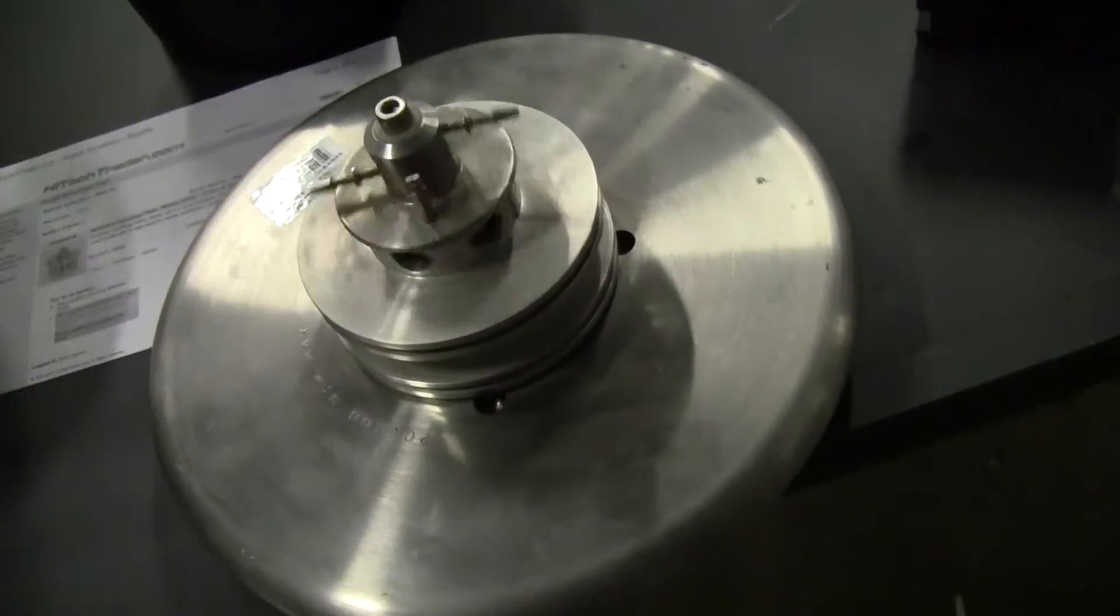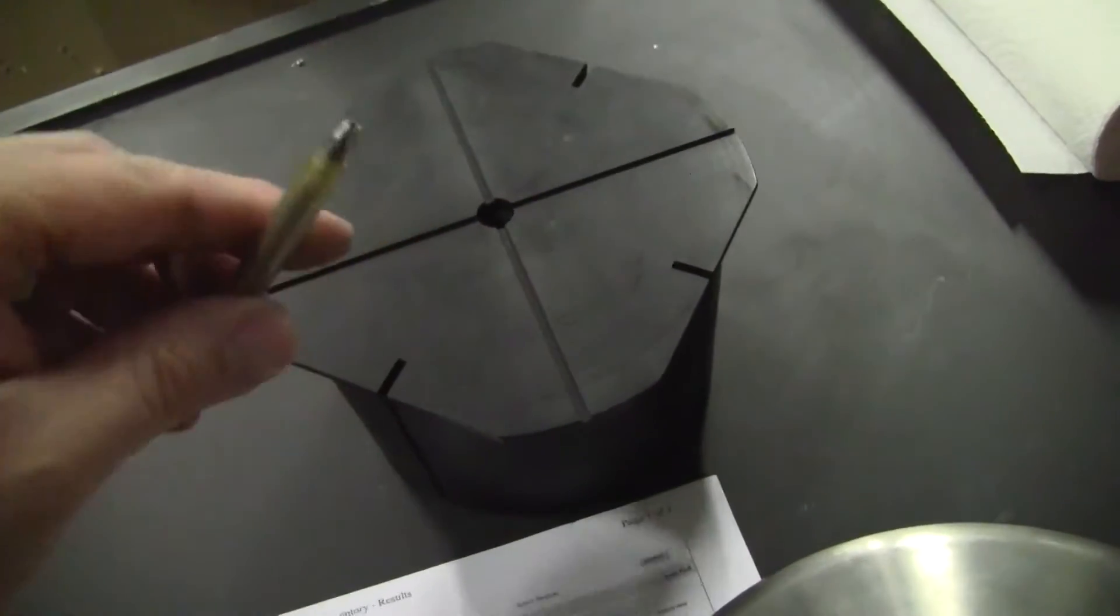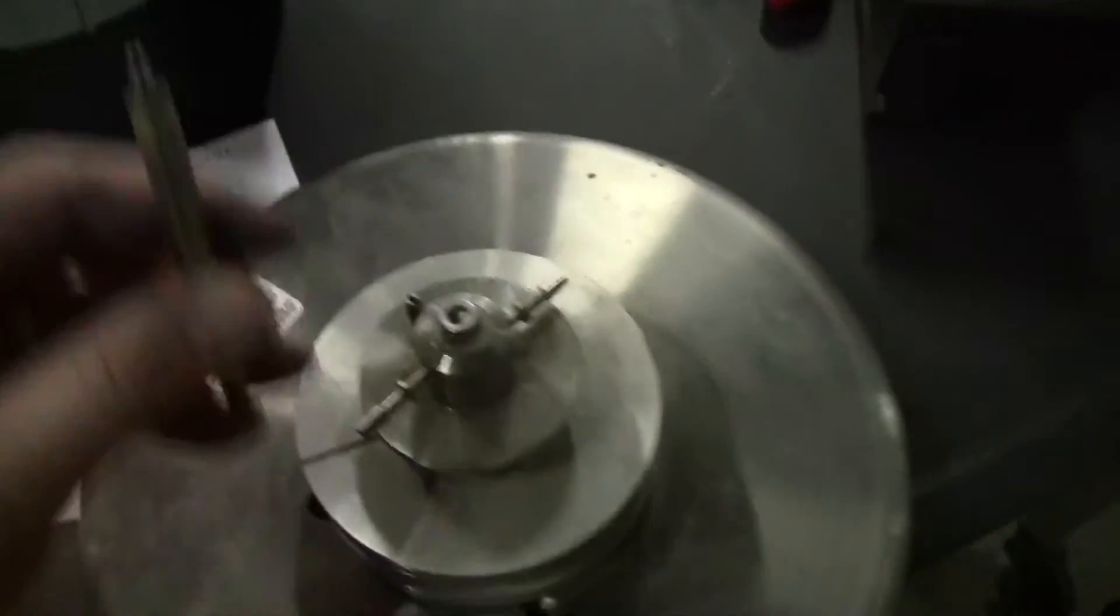Spins quite nicely. I don't think there's any issues. The only issue I would have is how does this piece integrate with the top. I've put it in up the shaft and it spins. Then it should sit in here, then spin this unit.